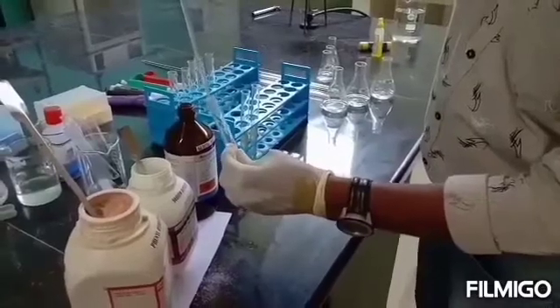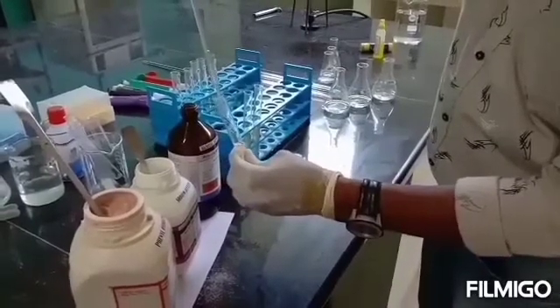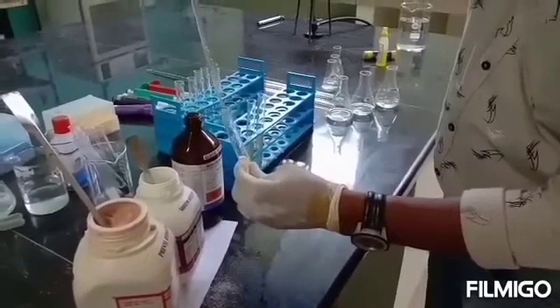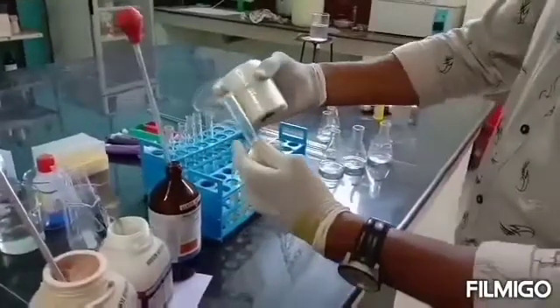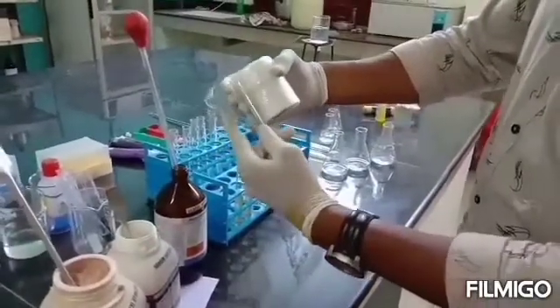It has to be shaken properly and mixed, for which I am using a parafilm cover, as you can see, so that the mixing will be proper.